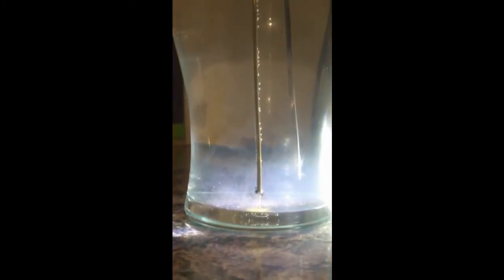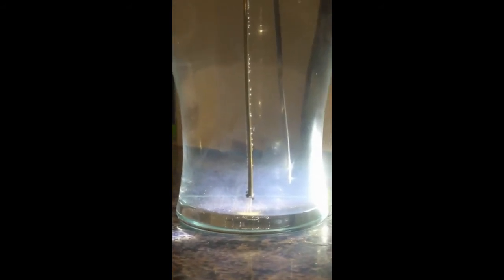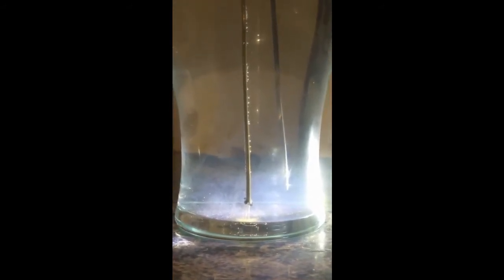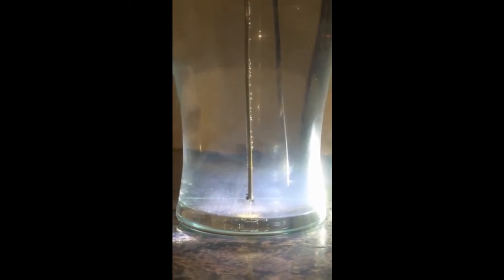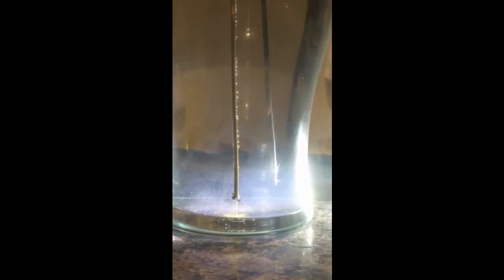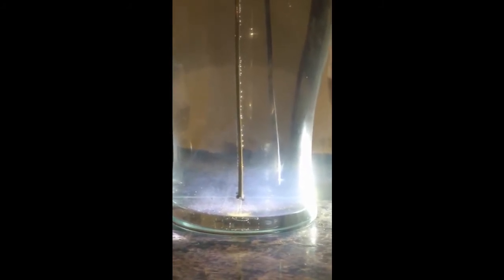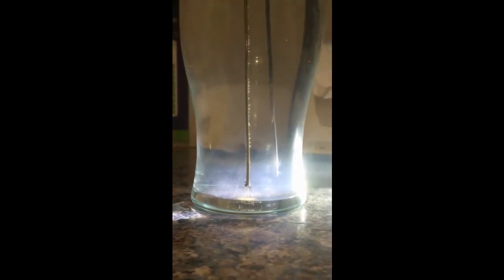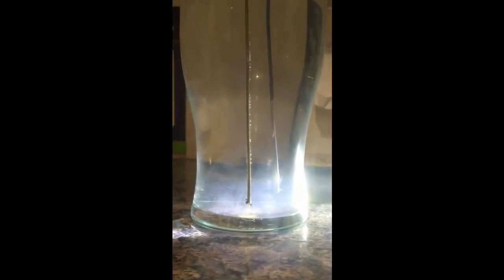It looks like soot and it will work its way up the rod to the surface until the whole rod becomes quite caked up with it. Your best chance of getting that out is to be very gentle with it and draw it out as slowly as possible in order to avoid dislodging all that black stuff into the water.